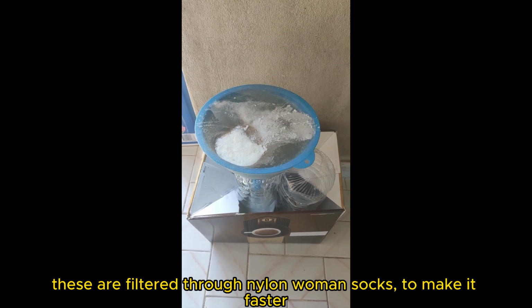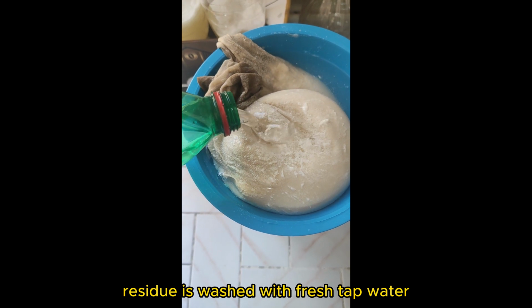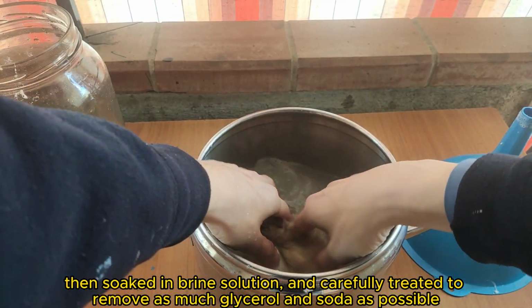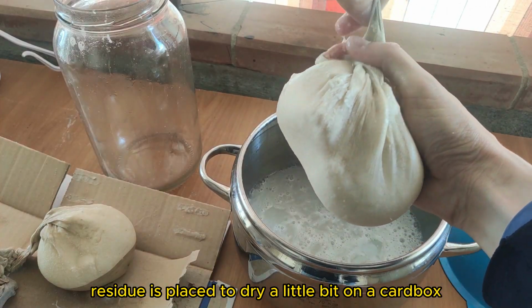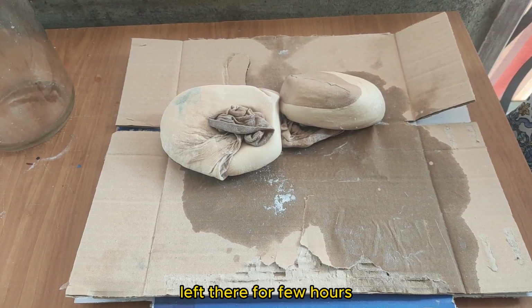These are filtered through nylon women's socks to make it faster. The residue is washed with fresh tap water, then soaked in brine solution, and carefully treated to remove as much glycerol and soda as possible. The residue is placed to dry a little bit on a cardboard box, left there for a few hours.